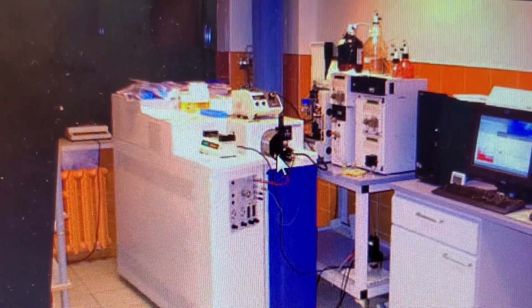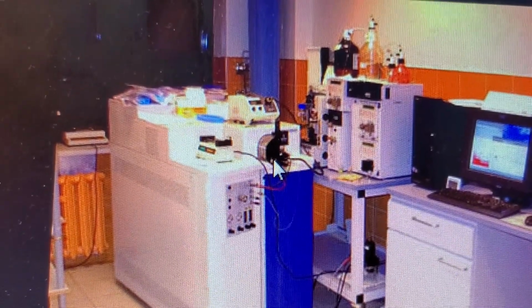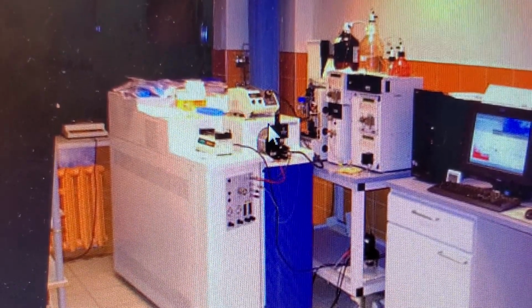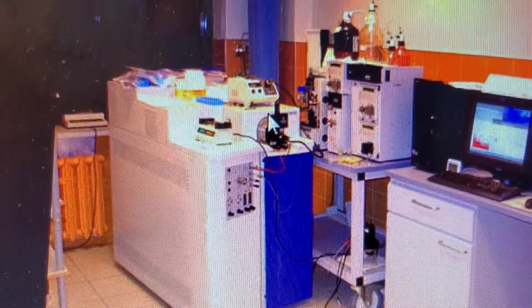Each sample, in pure form, will be analyzed by the mass spec for its molecular weight and the fragmentation pattern we'll be talking about soon.